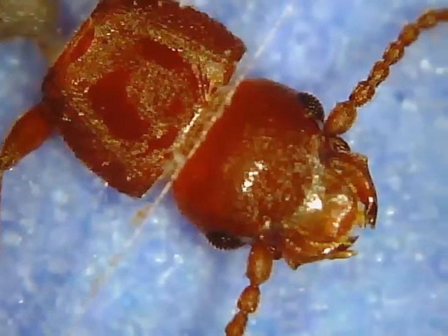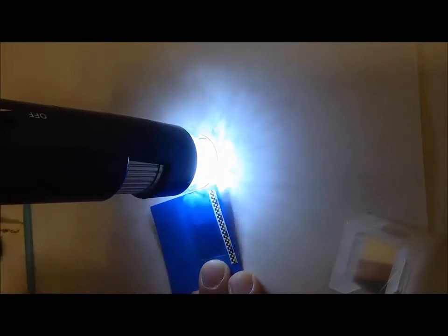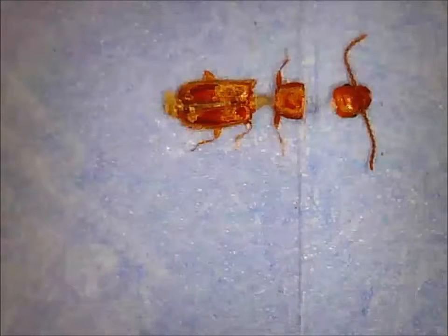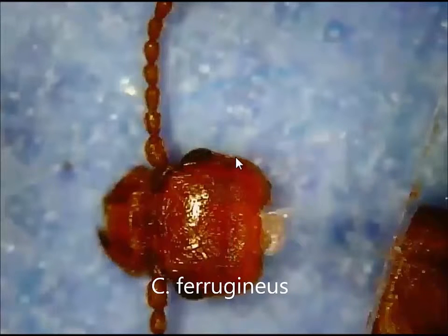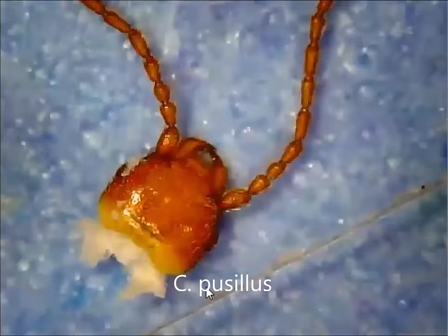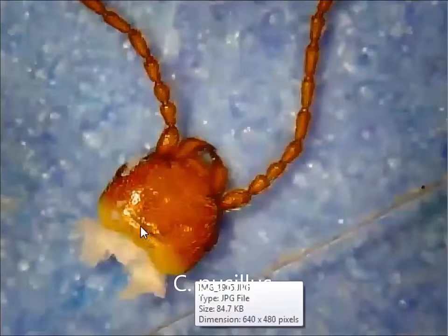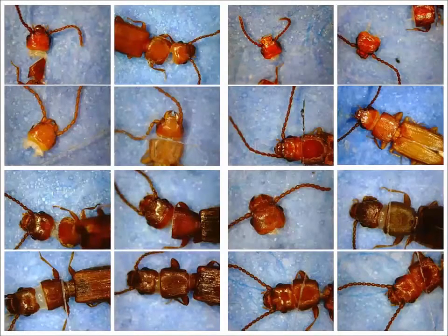And what I'll do is I'll just use a dissecting needle to knock the head off the pronotum. Now, if we zoom in on this, we'll see that Cryptolestes ferrugineus, even though there's a bit of a mark there where the head joins the pronotum, it's not as pronounced as the groove that you see on Cryptolestes pusillus. This is the transverse sulcus, and it's one of the best identifying features. Now there's a fair bit of variation between specimens, but you'll start to get a bit of an idea.